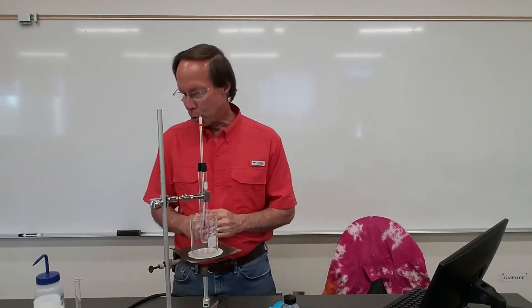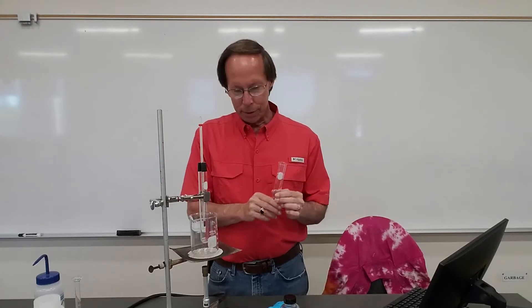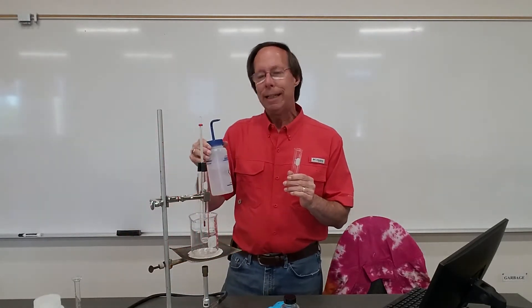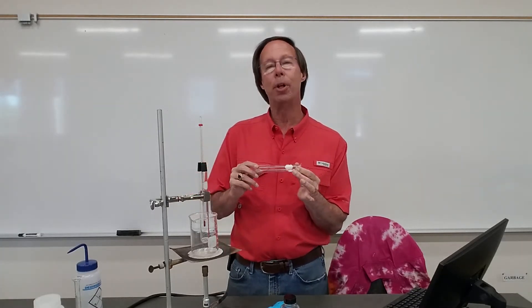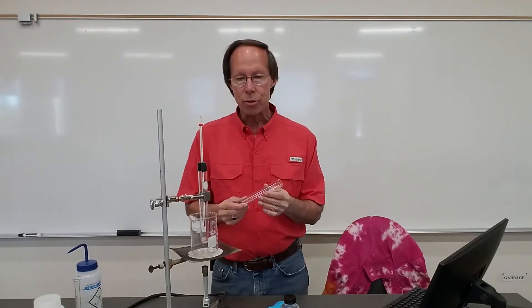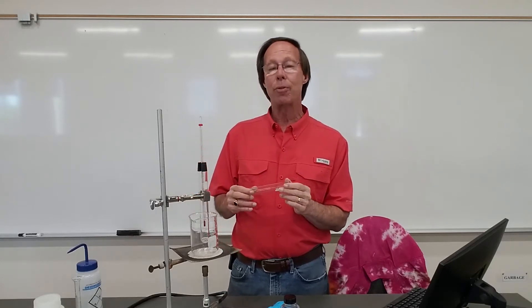If you look at the table in your lab book, it shows the solubility of each of the 27 different unknowns that you might have. To do the solubility test, we're simply going to take a test tube, add a sample of our unknown, add some deionized water, and then mix those together and observe whether they remain mixed or separate. If they remain mixed, you have a soluble unknown; if they separate, your unknown is insoluble. Based on that first test, you'll be able to narrow down the identity — either your unknown will have the letter I for insoluble or the letter S for soluble.